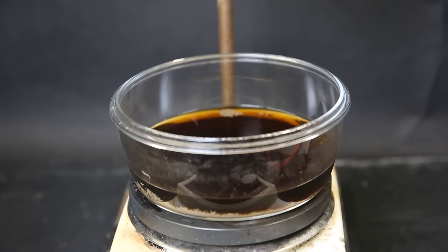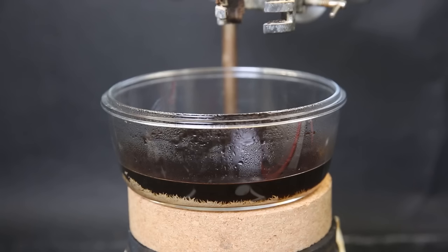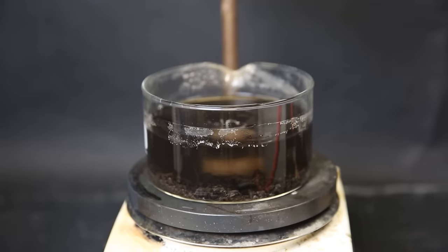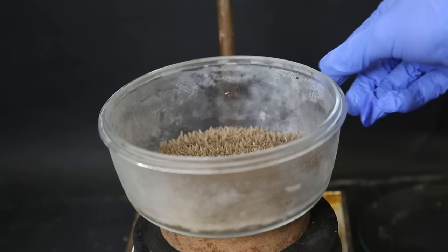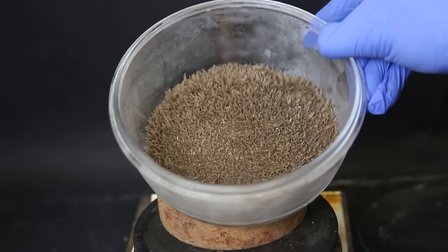We can see that the decrease in temperature from filtering the mixture made a lot of product crystallize out. I set it on a cork ring to cool it down further, and wait until it reaches room temperature. After that, I set it inside the freezer at minus 26°C for 20 minutes. I also take the remaining solid that was left in the crystallizing dish and repeat the same process.